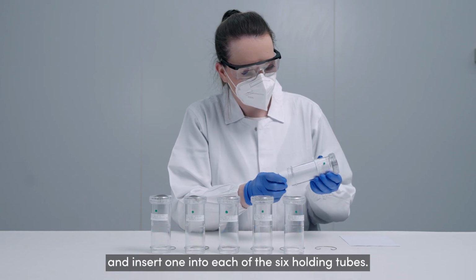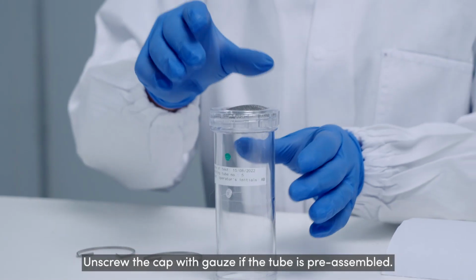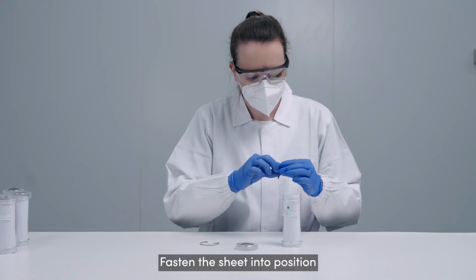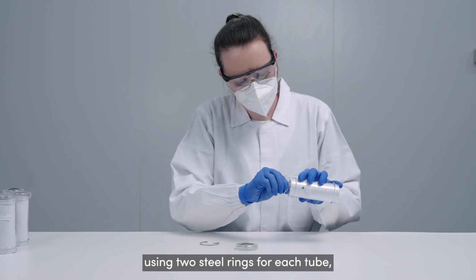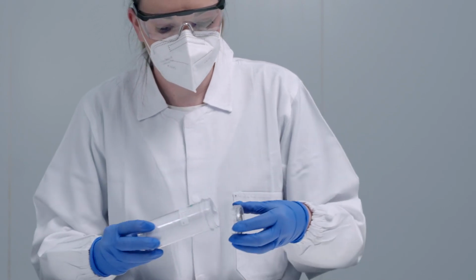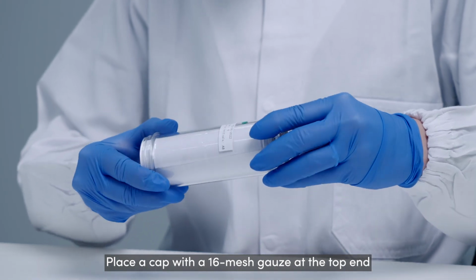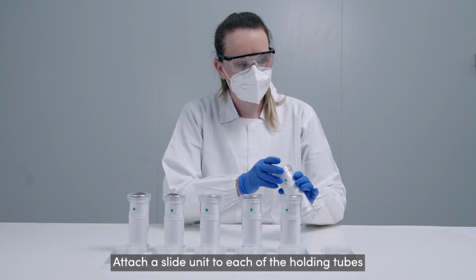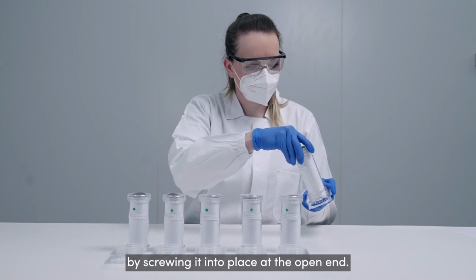To prepare the green dotted holding tubes, take 6 sheets of clean white paper rolled into a cylinder shape and insert 1 into each of the 6 holding tubes. Unscrew the cap with gauze if the tube is pre-assembled. Fasten the sheet into position against the wall of the tube using 2 steel rings for each tube, 1 at the top end and 1 at the bottom end. Place a cap with a 16 mesh gauze at the top end of each holding tube and screw into place. Attach a slide unit to each of the holding tubes by screwing it into place at the open end.